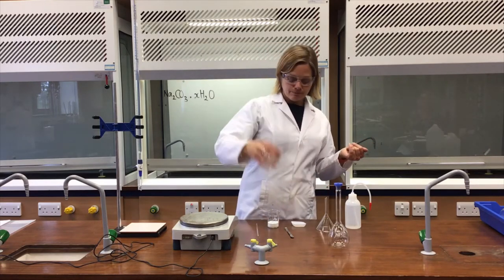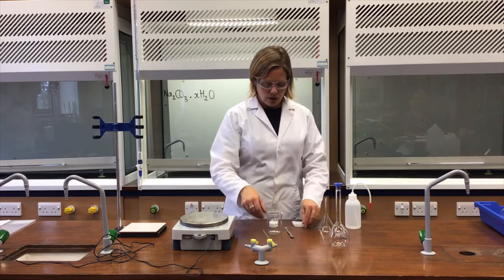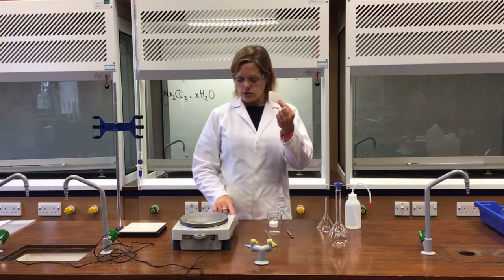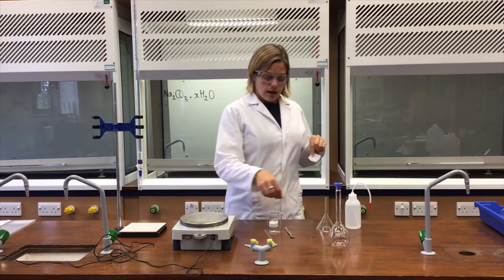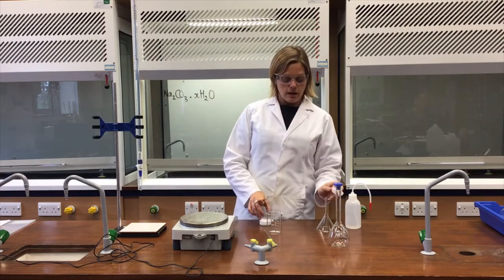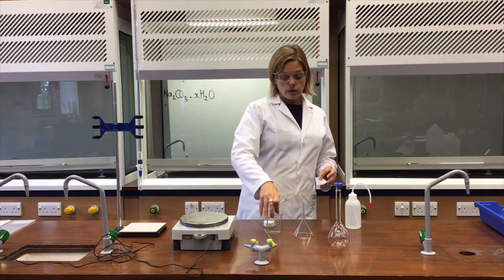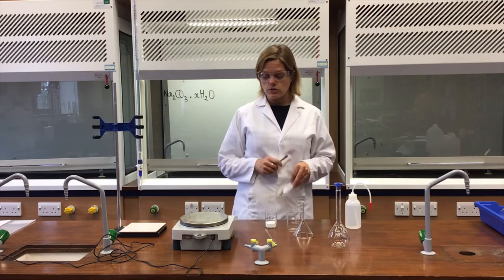The other apparatus I need is a clean beaker, a stirring rod, a weighing boat (the thing that goes onto the balance), a spatula, the washing soda, and a funnel. This is just part one of the practical: making the solution up.